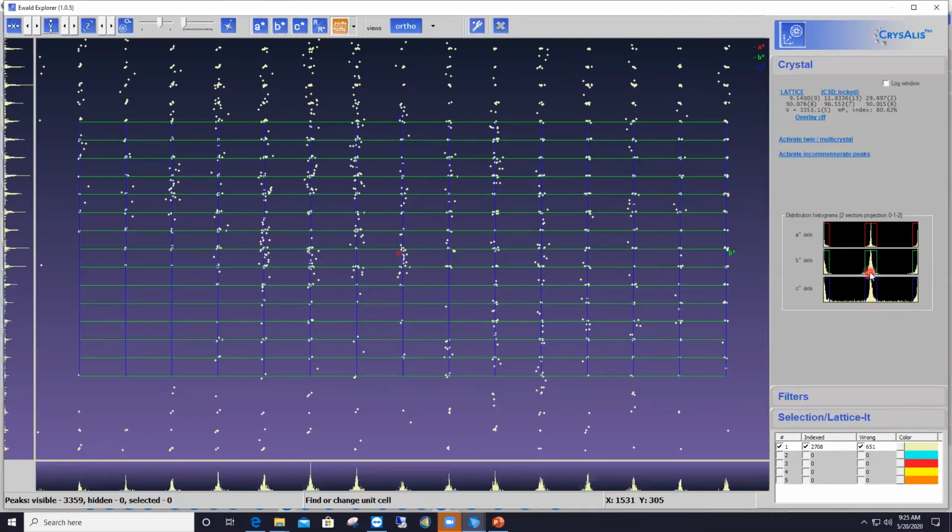So you see that now we've got strong and sharp reflections within the boxes representing the lattice points. That means that the centroid of these reflections are exactly where the program expects them to be. So with these unit cell parameters now, we're hitting the nail on the head, okay? And that's how you clean up a diffraction pattern from indexing.